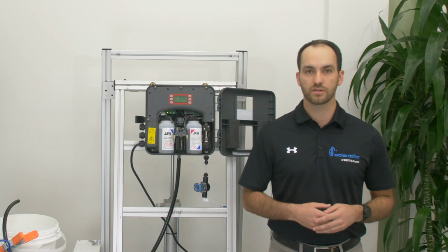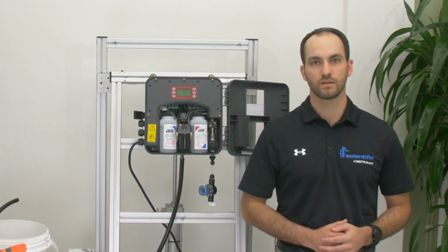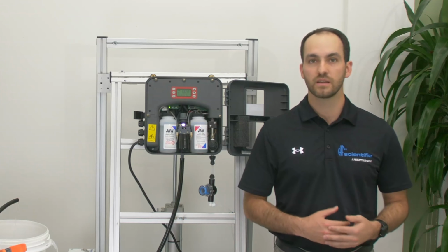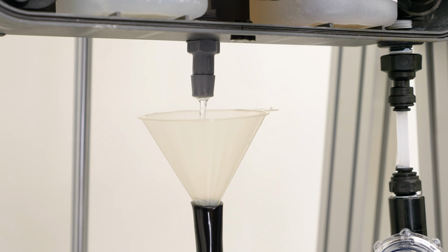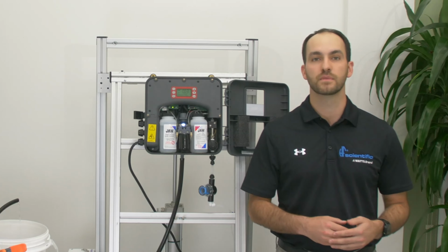There are a few errors that can pop up from issues in this flow path. We will start with the NPRG or PRG errors. These errors mean the cuvette is not draining properly and the photo eye is still seeing water inside the cell when it's supposed to be empty.